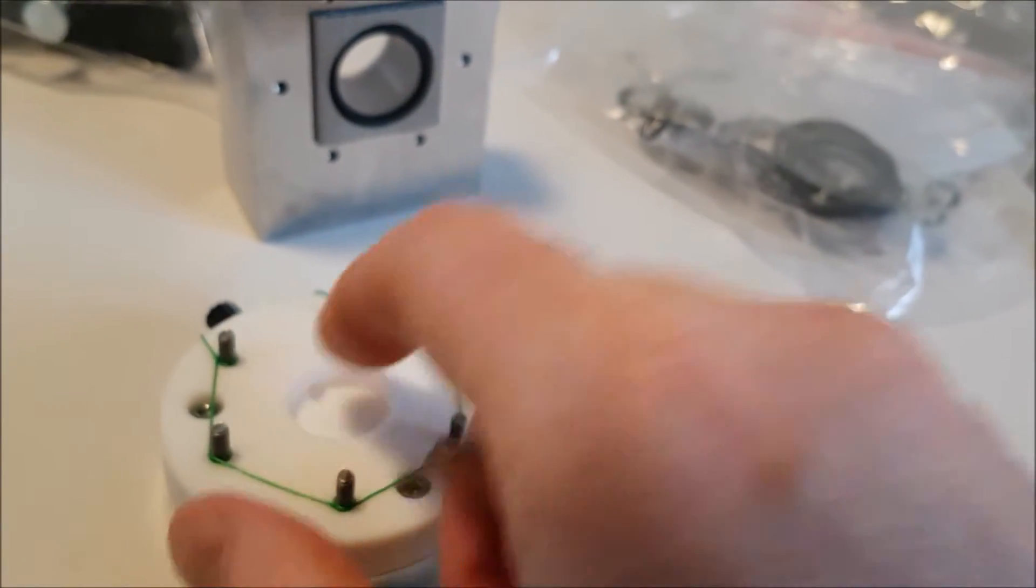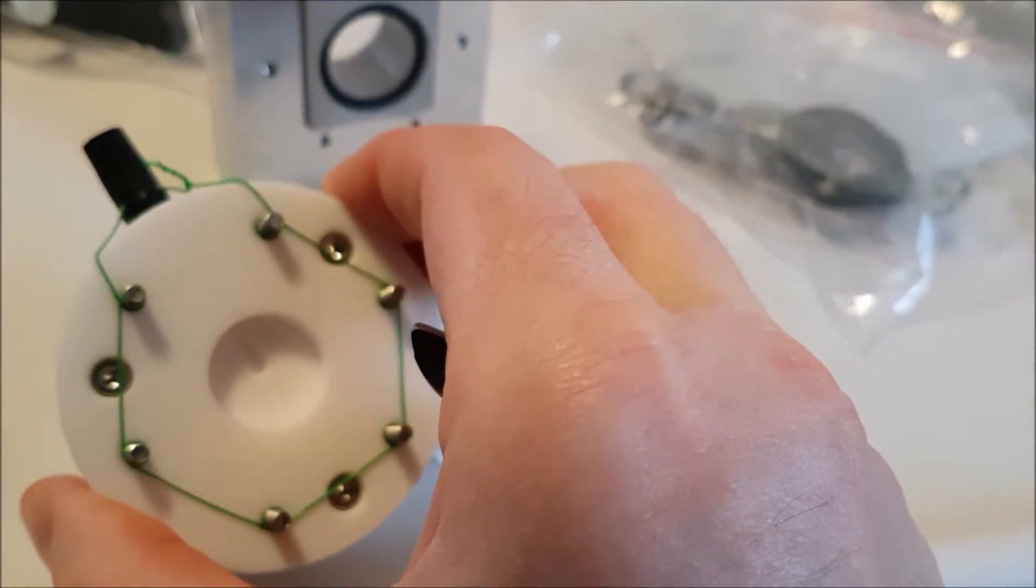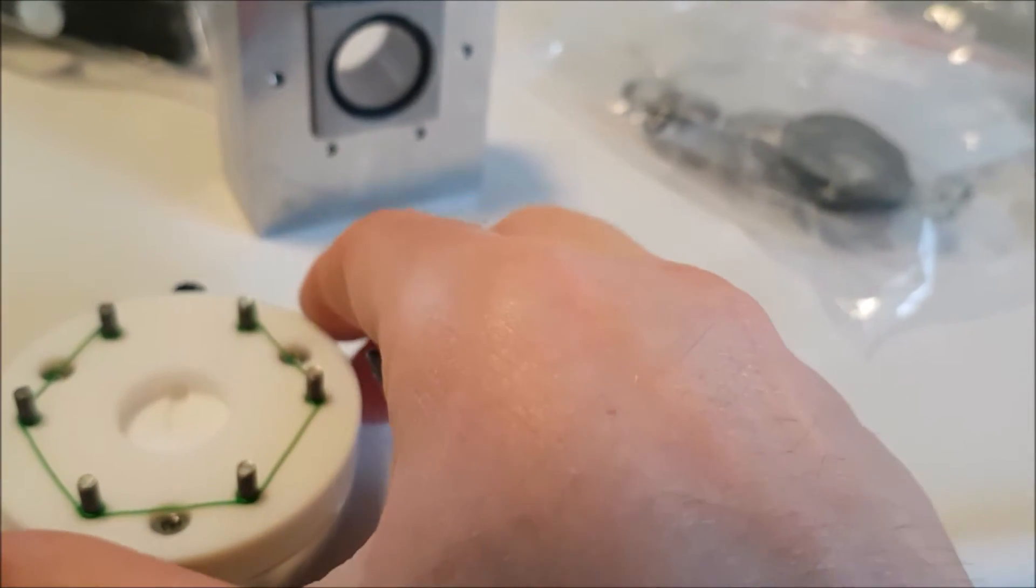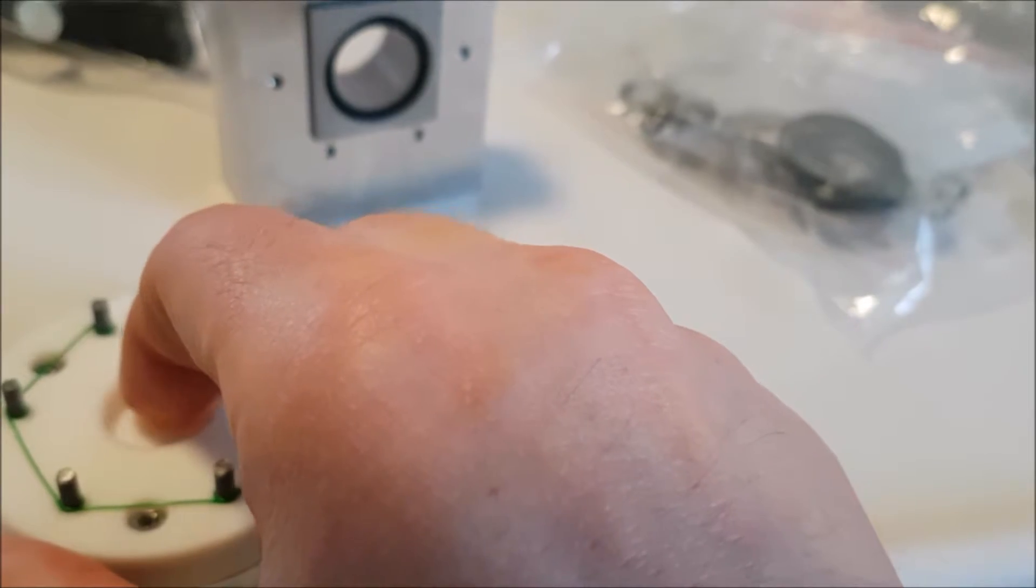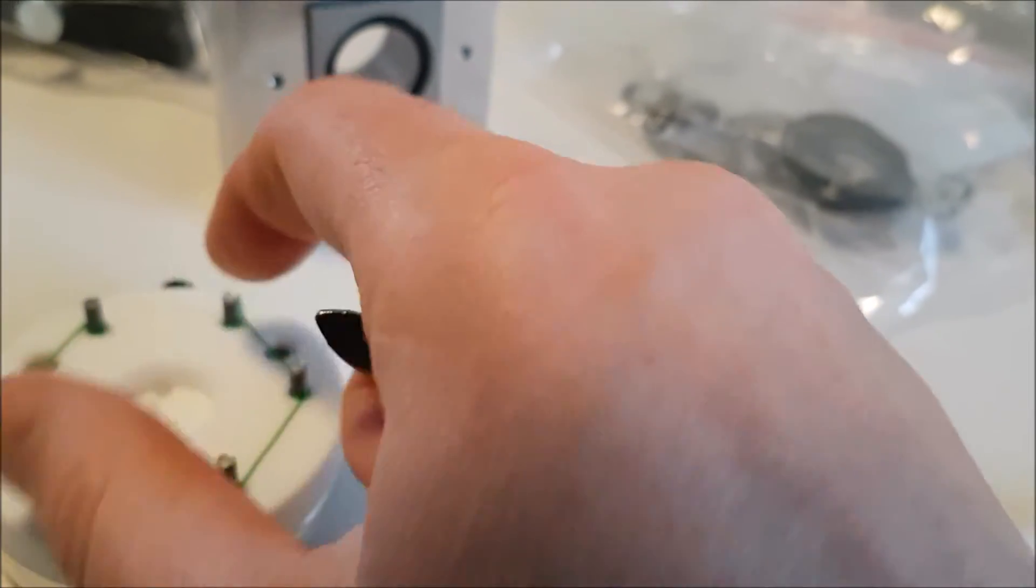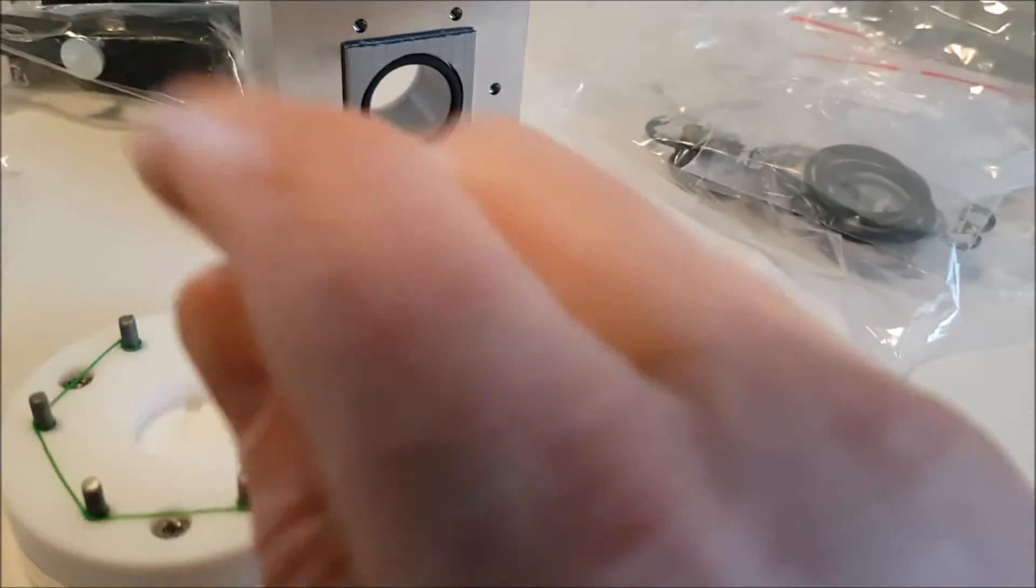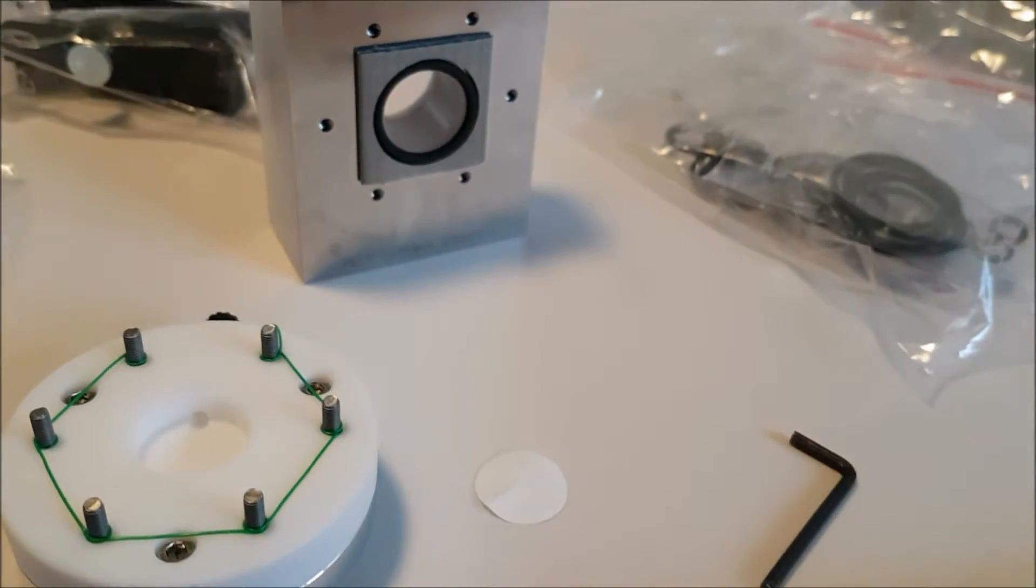I know you want to spread that out a bit, but what I actually say is we can put a sort of disc on the back of there or something like that. Or maybe you can do your wire idea. In fact, just put a wire down the middle, around the edge, put your carbon on top and then put an o-ring to give it a bit of pressure.